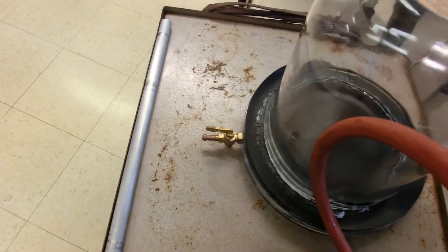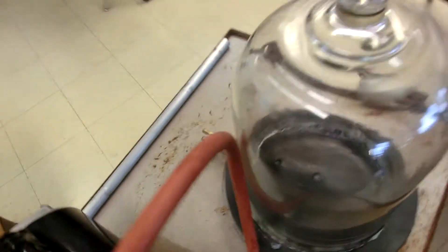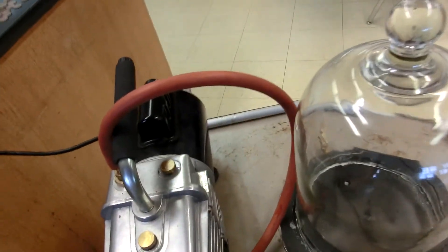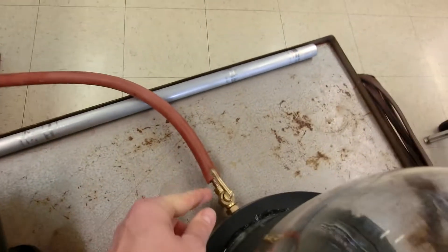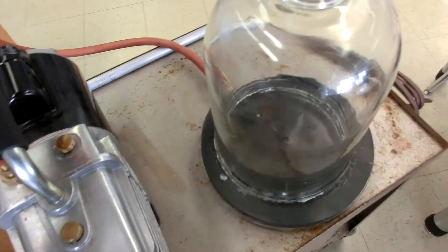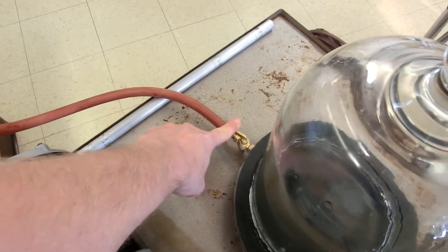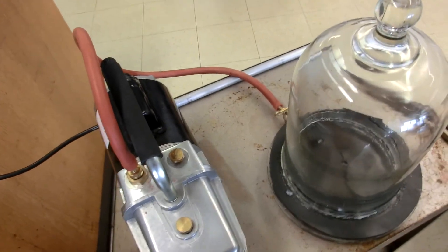If you have any questions about how to use the vacuum pump without getting a whole mess of oil spilt all over the place, please ask someone who you think might know. But once again, the quick procedure: when you go to turn it on, step one, hoses are connected and the vacuum pump is plugged in, making sure that the valve is open. Turn on the vacuum and as soon as you shut off the pump, close this valve like that. If you have any questions, please ask.